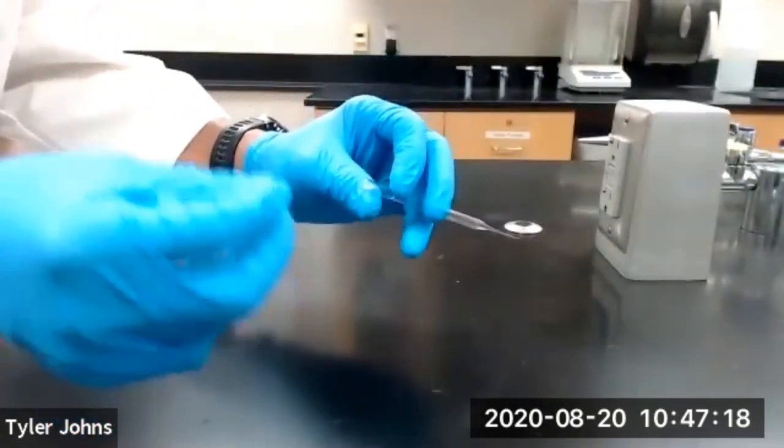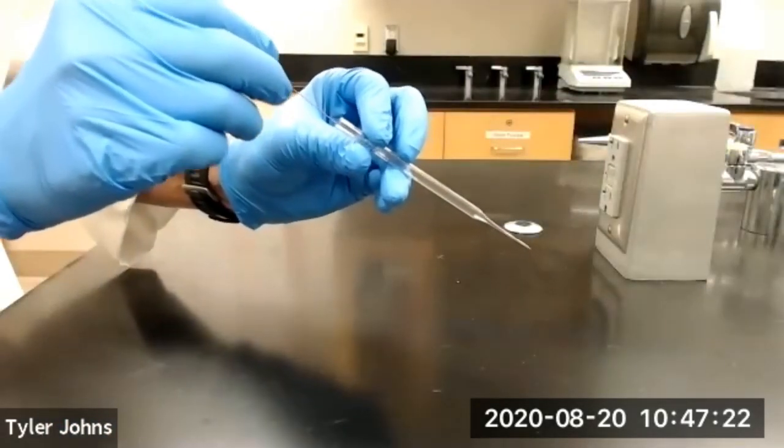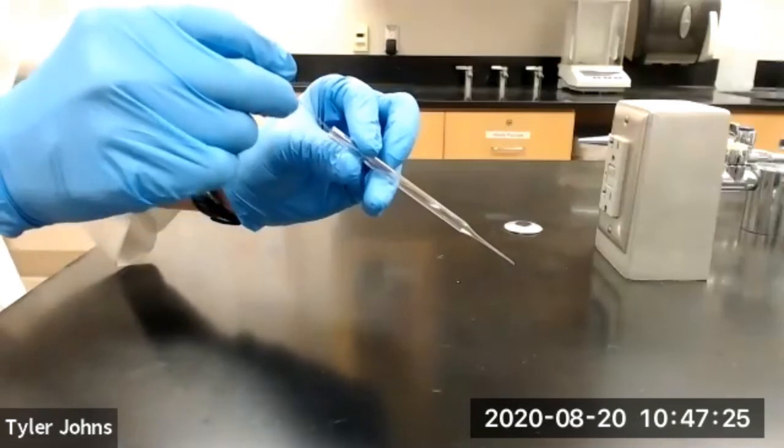We'll then use a very thin copper wire to push the cotton all the way down to the end of our pipette tip.